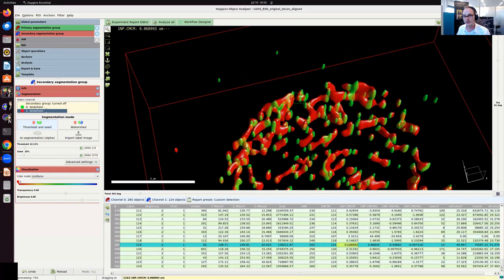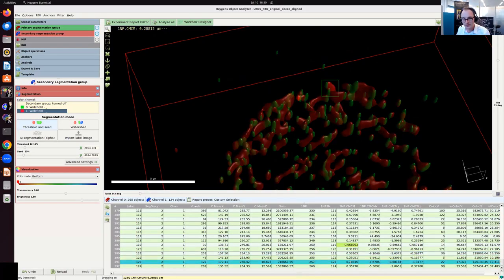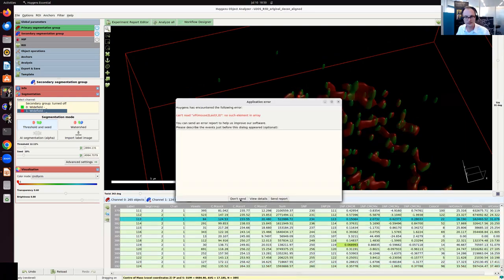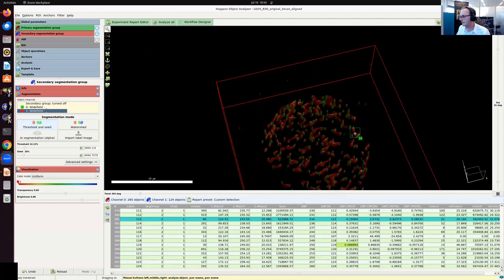So this one has dissolved, so it has a very small distance. And other ones like this one, oh, it's just my mouse. They have a bigger distance, so I can visualize that.